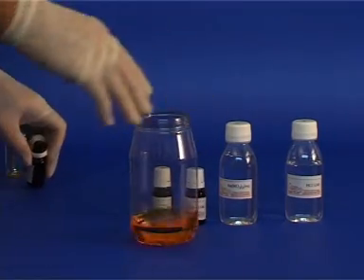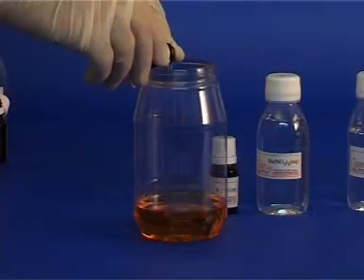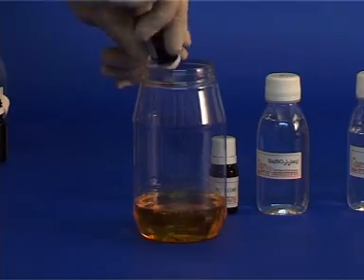Adding bottle 3, which contains a base, will neutralize the acid and the color will return to its original yellow.